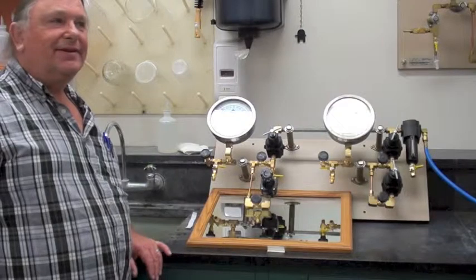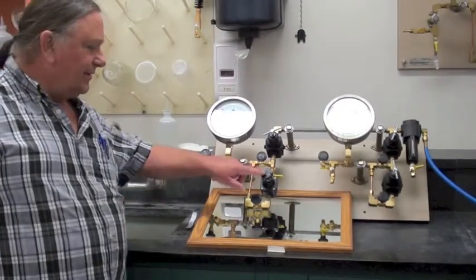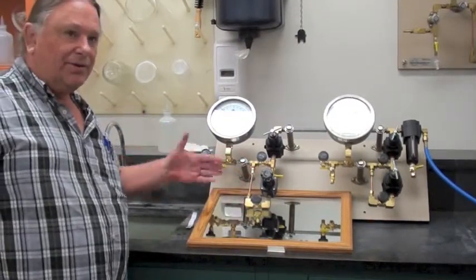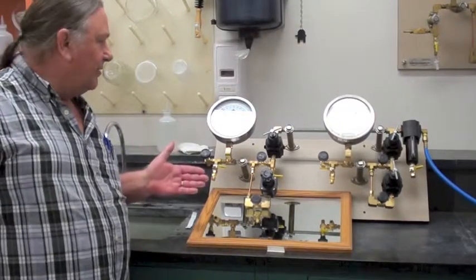The purpose of this video is to show the normal operation of the Nullmatic regulator, which has some bleeding in the back. I want to demonstrate what's normal, what's not, when it's working properly, and when it's not working properly.